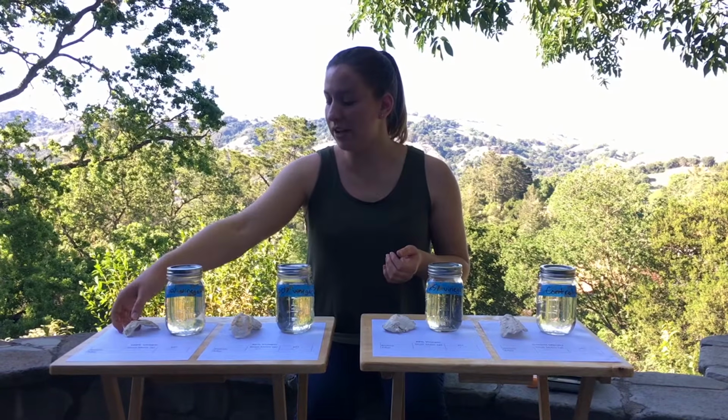And this shell over here that was in our pure vinegar condition, when I first took it out of the jar, it was really soft and pliable. It was almost like rubber. And now that it's dried out, it's become really fragile and brittle and kind of flaky. And I'm having to be careful as I hold it here not to let too much of it break off, because we still need to weigh these shells to complete our experiment.